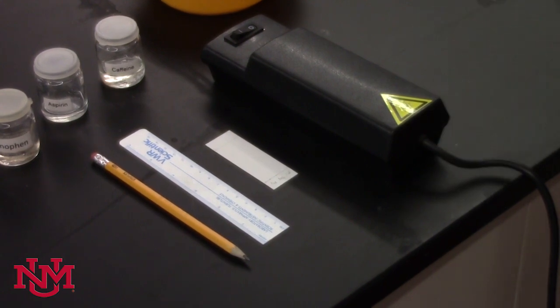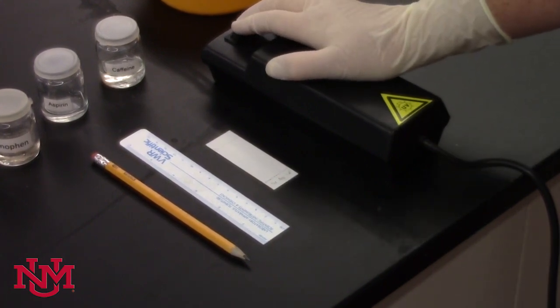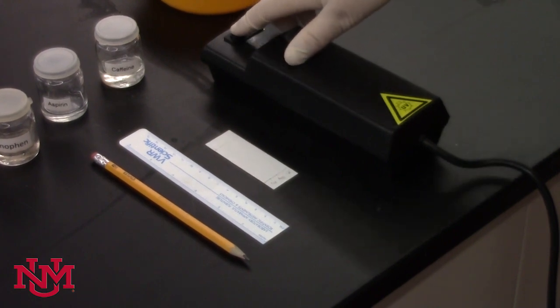Chemical compositions can also be used, such as molybdenum and other metals, but we use a UV lamp in this lab. Never let it shine on your skin directly and don't shine it into your eyes. Don't look into it directly. It's like a really powerful black light.